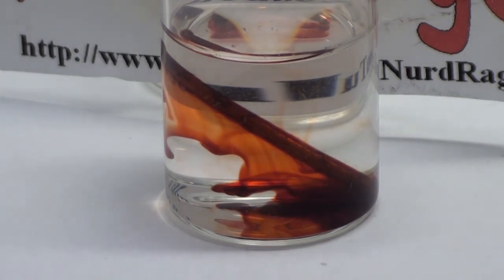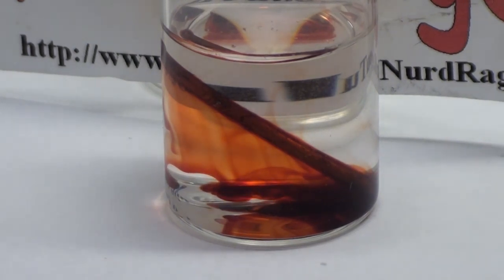But since it only forms near the surface of the nail, it appears the nail is bleeding. It's a really simple experiment but has a very dramatic effect.